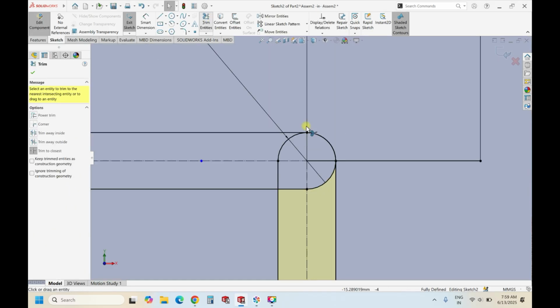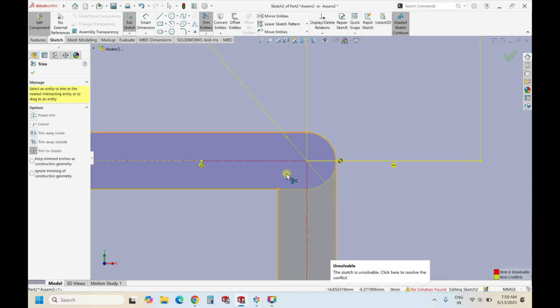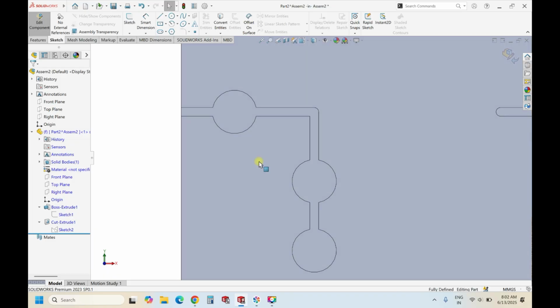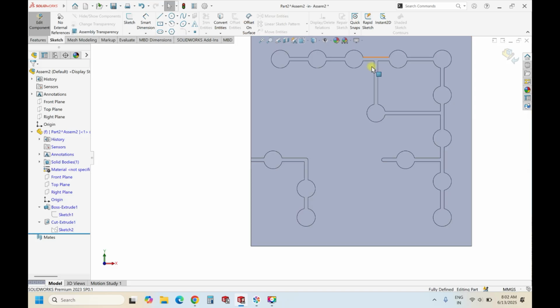So there is one more intersection coming over here. Now it is fine. Yeah, so there is an extra line which we missed, so we have trimmed it. Once we trim it, everything is okay. Okay, so these are the 1 mm things. So let's have a connection to this and to this.